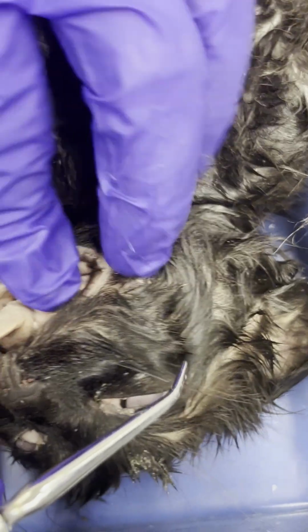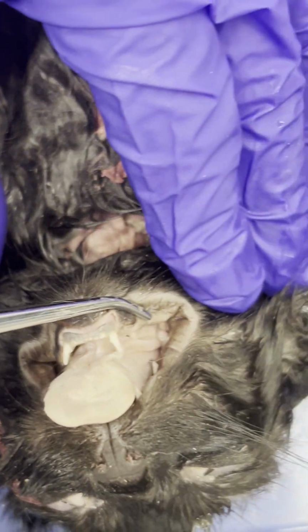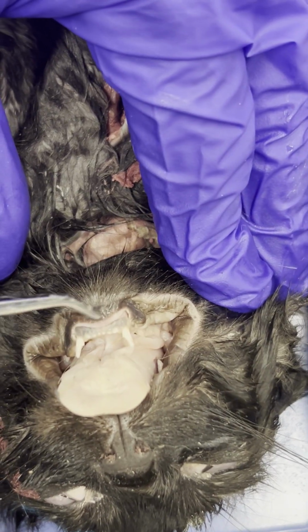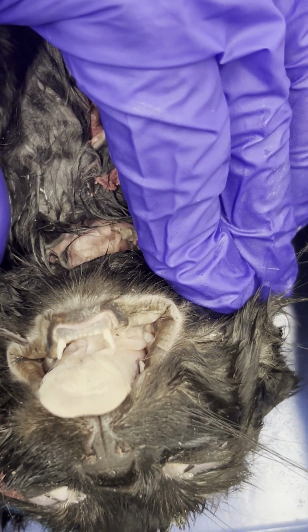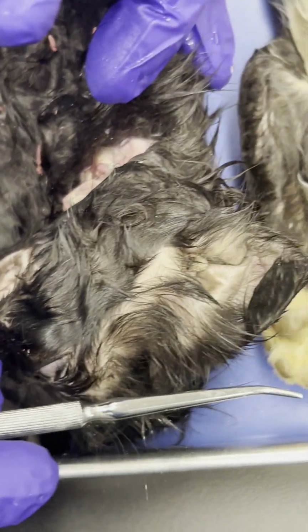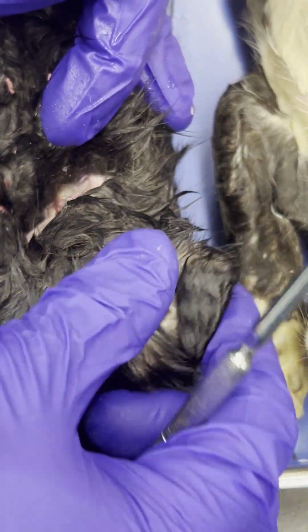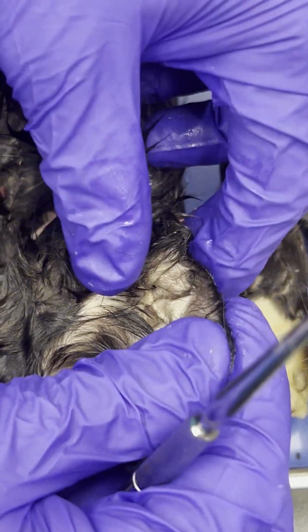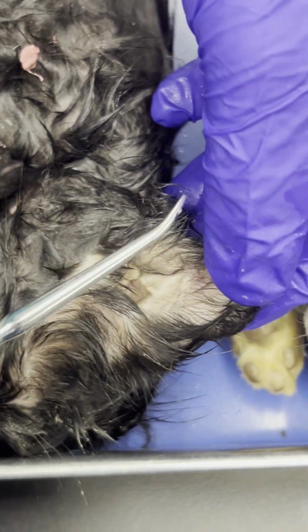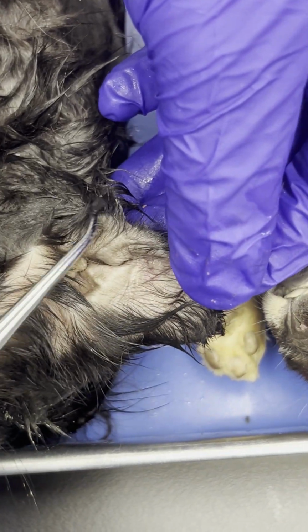Also the mandible. Mandible is going to be the lower jaw of the cat in this case. And then also a structure called the parotid gland. The parotid gland is the largest salivary gland. I've struggled with that word right there. So you should know what the function of it is, but where is it located? It's at the base of the pinna of the ear.